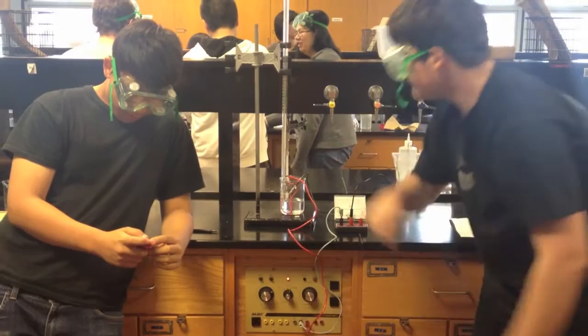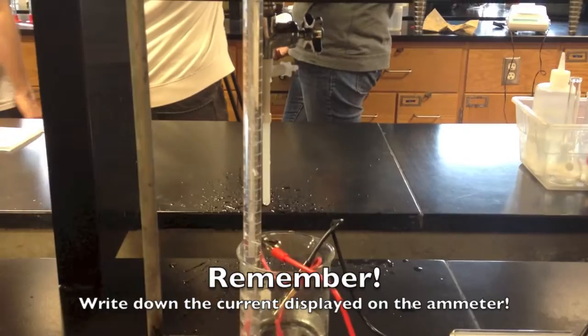See, bubbles start to form. Press the start button. Still going. Alright, running for as long as you like. You're going to have two trials anyway. I'm going to say three, two, one, and at the end you're going to stop the timing. Ready? Three, two, one, stop.